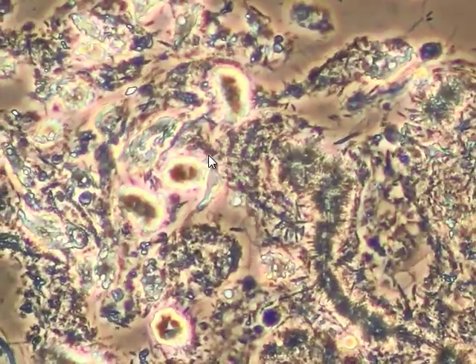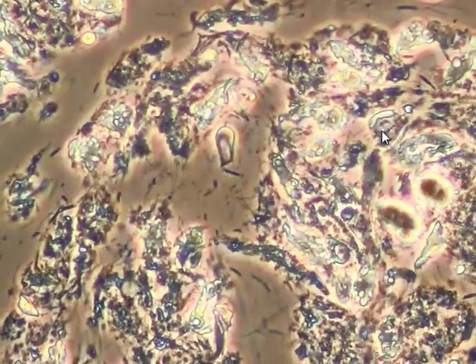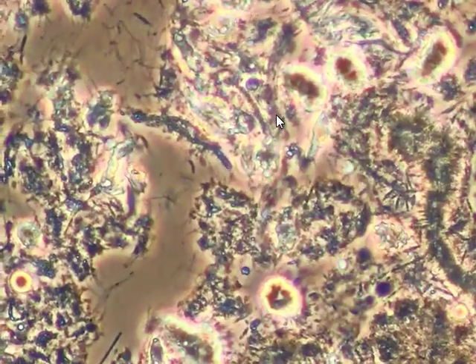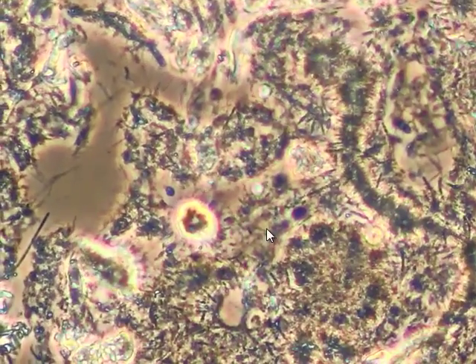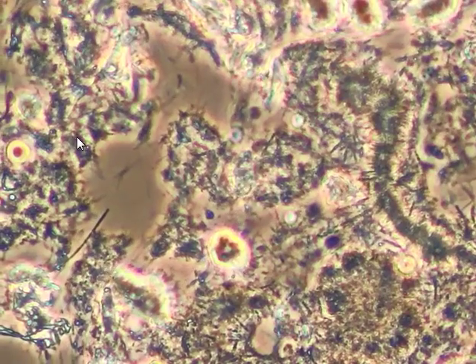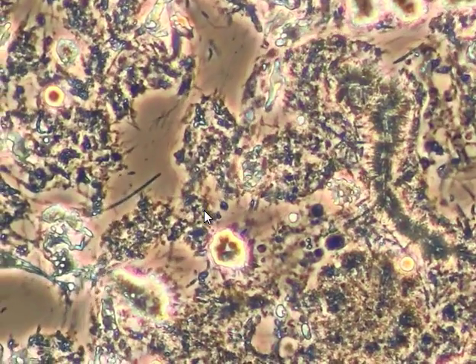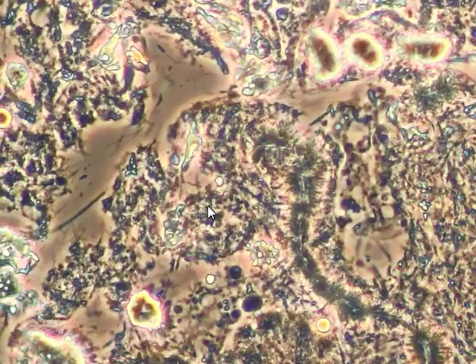This is how you actually lose teeth and lose bone around your teeth — from these bacteria and amoeba. This is a pretty good example of this process of how we kill these things inside the mouth.